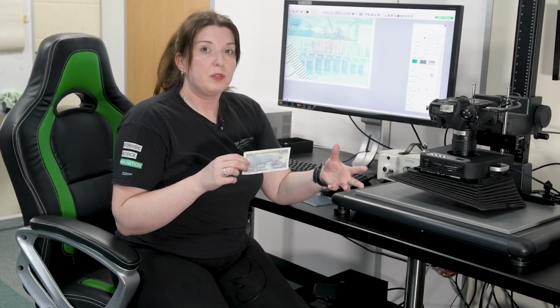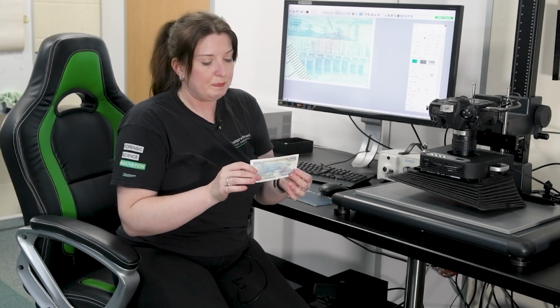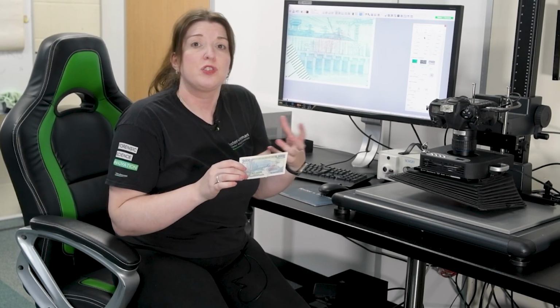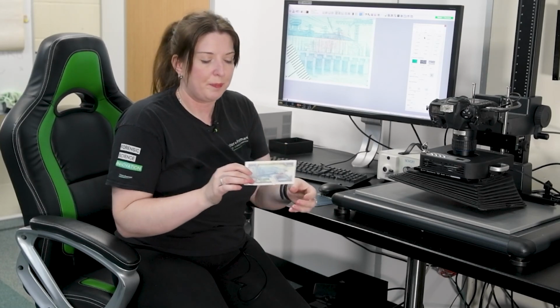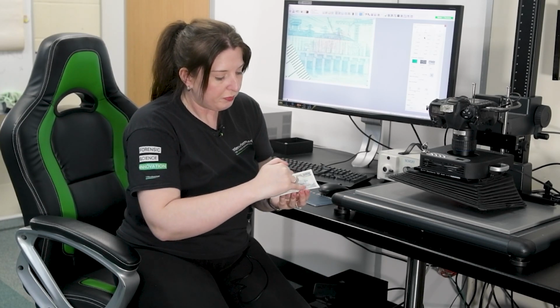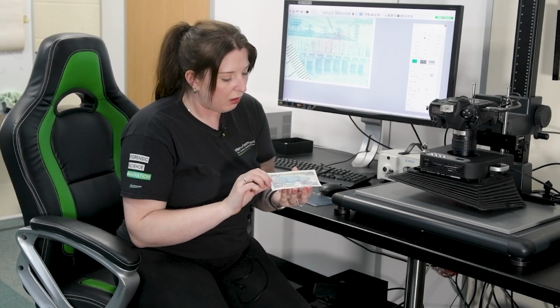Now, so far we've done some quite simple techniques in the software, just a couple of clicks of the button. Sometimes we can have even more challenging samples though, where we're going to have the software do part of the work for us, and then it's up to us to do the final part. Here we have a Vietnamese banknote, and it's actually been treated with ninhydrin. So we have that kind of pinky purple colour on top of this kind of blue and yellow banknote.